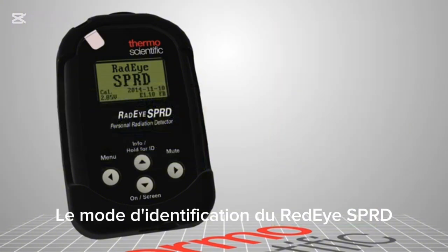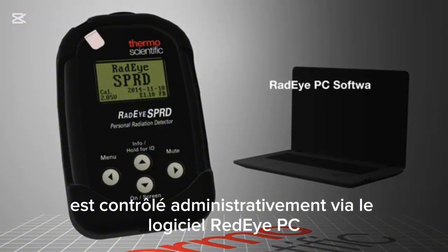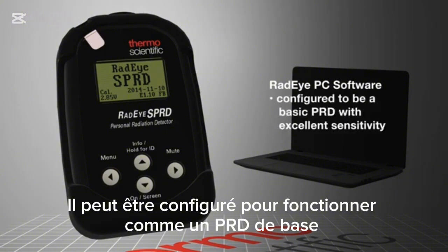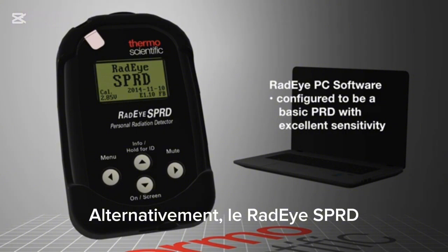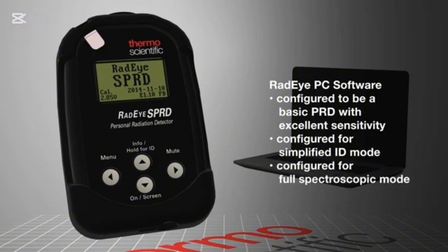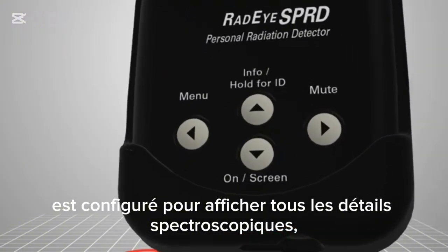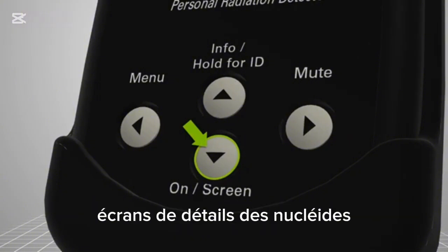The identification mode of the RadEye SPRD is administratively controlled with the RadEye PC software. It can be configured to operate as a basic PRD with excellent sensitivity and no identification capabilities. Alternatively, the RadEye SPRD can be configured for simplified ID mode or full spectroscopic mode. If the RadEye SPRD is configured to show all of the spectroscopic details, the down arrow is used to scroll through a number of nuclide detail screens.